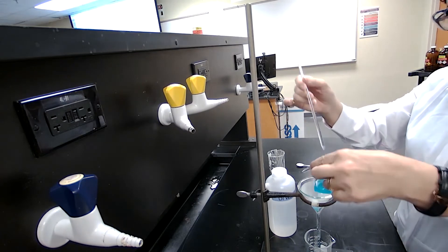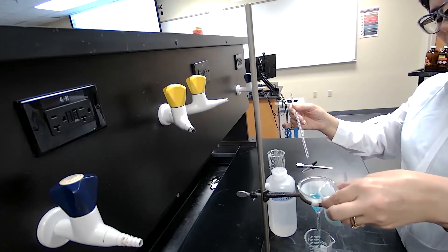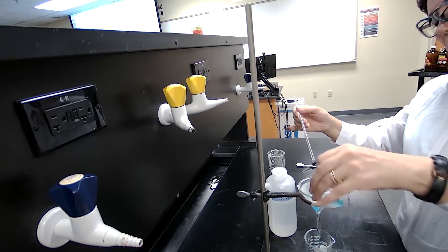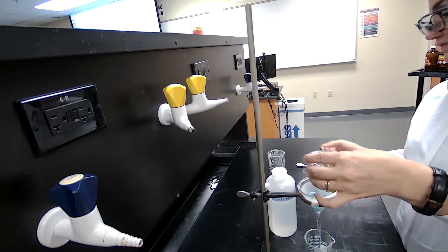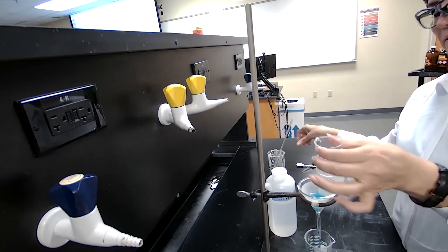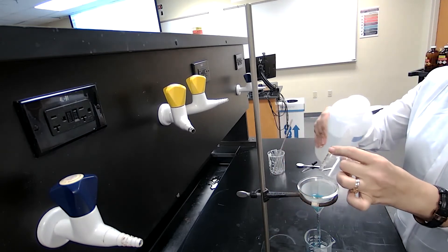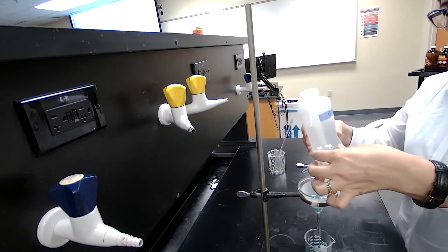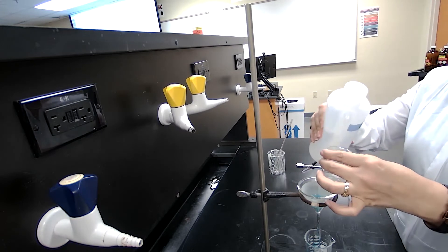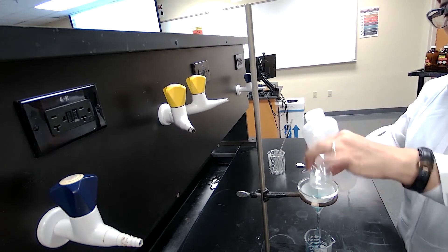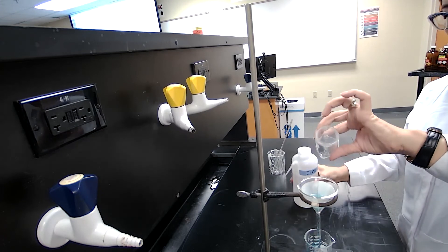So we are mixing it, agitate, and then add to the filter paper. If you have leftover solid in the beaker, keep adding the solvent that you were using and pass it through the filter paper to make sure that everything is transferred.